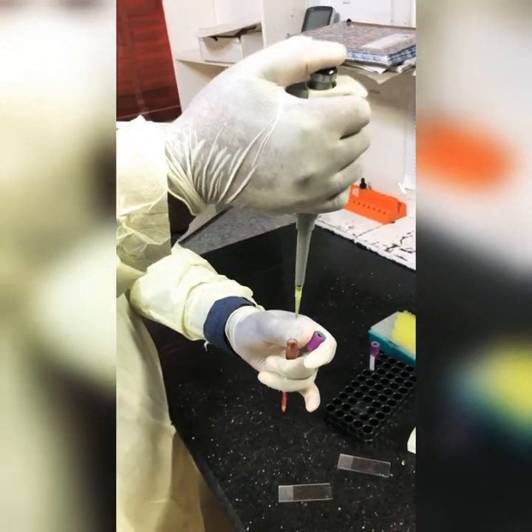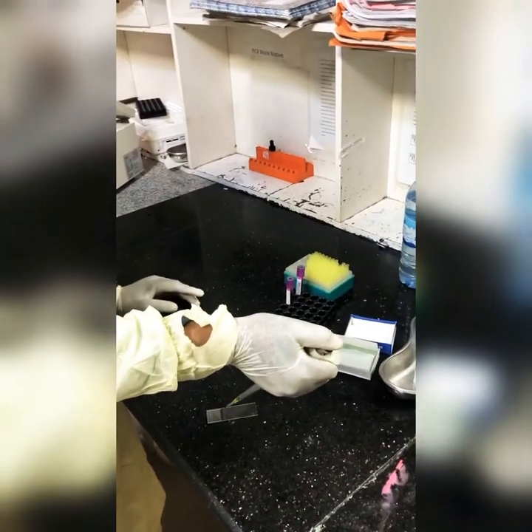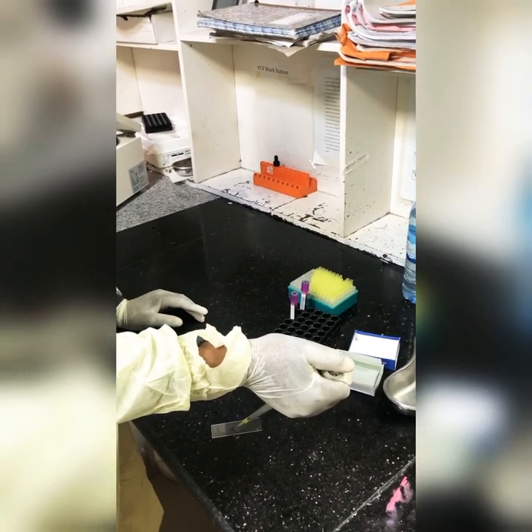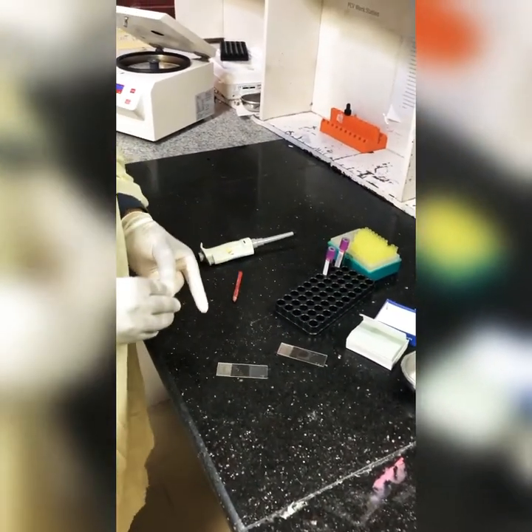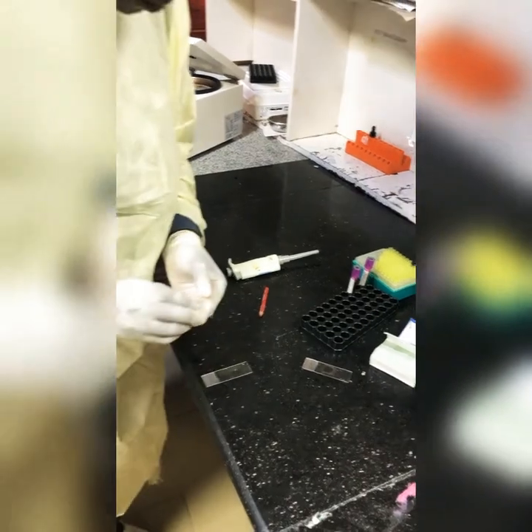So I'm doing it the second time — I'll pick the same blood, two microliters of blood, place it on one end of the slide, discard the pipette tip. Then take the cover slip and make it on the flat surface.